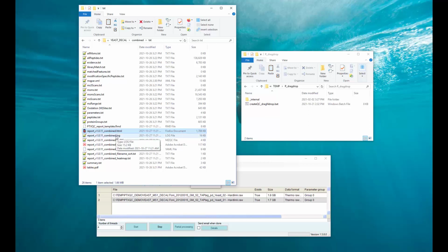Then there's a log file, which basically is a copy of all the output of the window that we just saw. So in case you want to look up what PTXQC told us there, you can do that here. Then there's an mzqc file, which contains machine-readable, basically metric data. Then there's a PDF file, which is basically telling you the same story as the HTML. It's just a bit less interactive. Then we have a configuration file, and we're going to inspect that when we look at the HTML report. And then there is another file which we're also going to see when we look at the report.